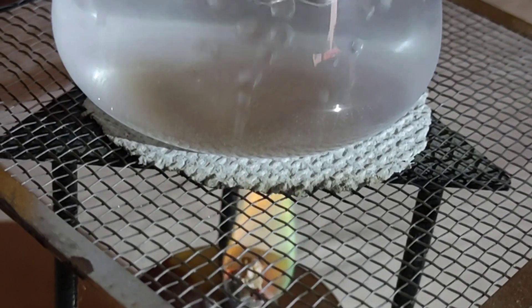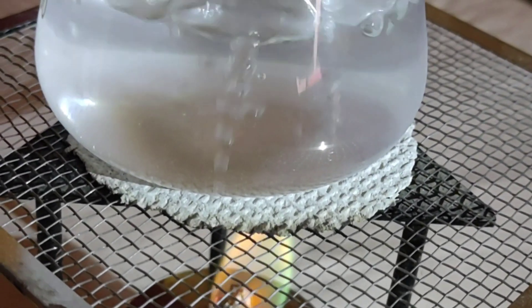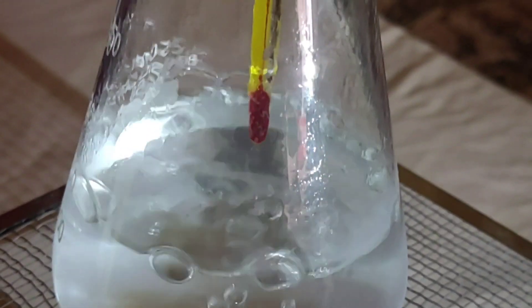What have you learnt from this experiment? The boiling point of water remains constant during the boiling of water.